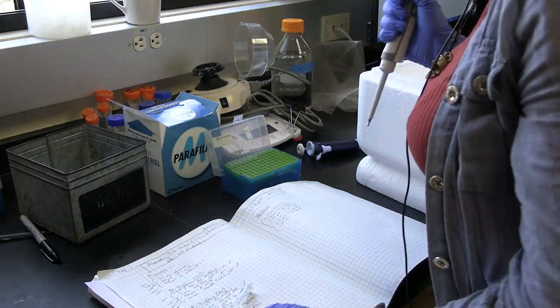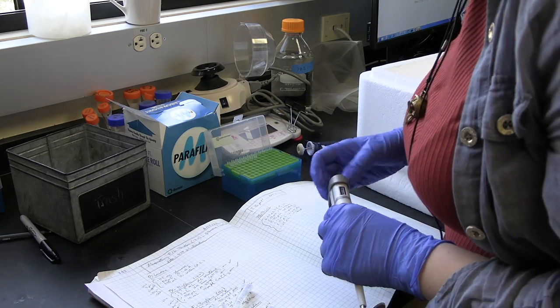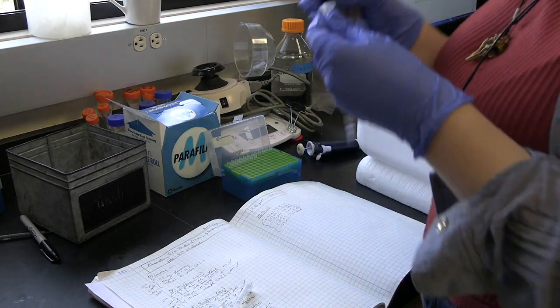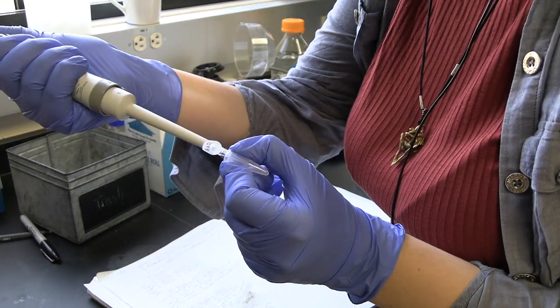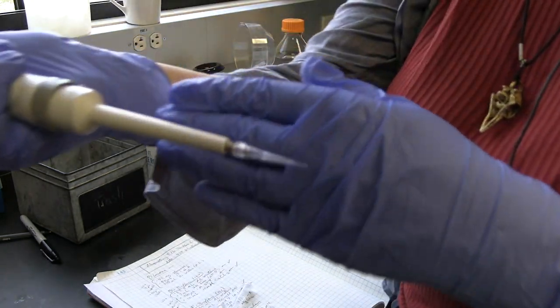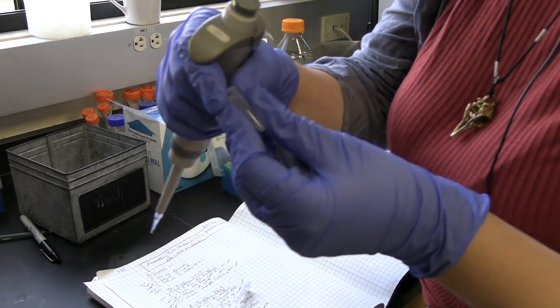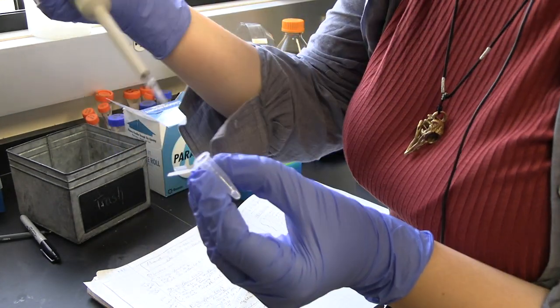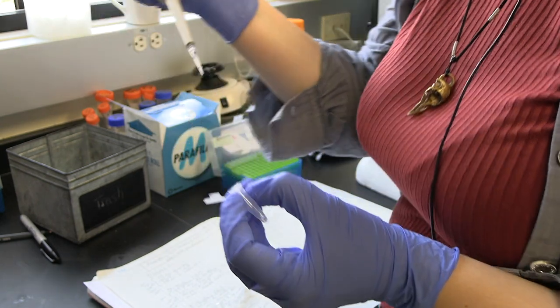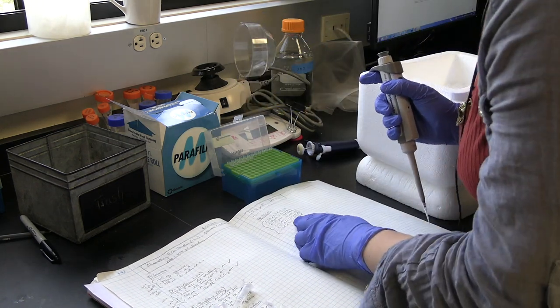Next thing we're adding is 1 microliter of 100 millimolar GTP. GTP is what causes the microtubule dimers to polymerize. If you get any small droplets in your sample, be sure to gently guide them down to the volume of the rest of the sample, so anything that needs to be in there for polymerization gets in. You don't want your concentrations to be off for reasons like that.